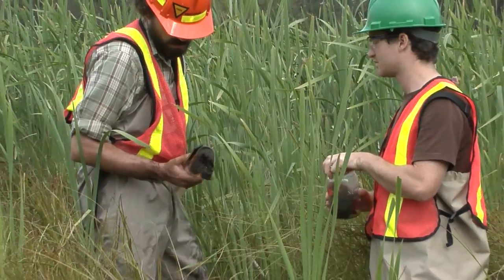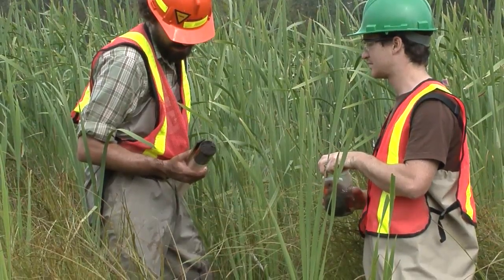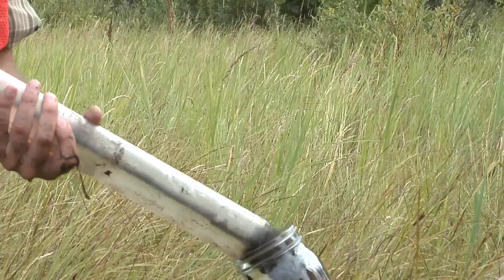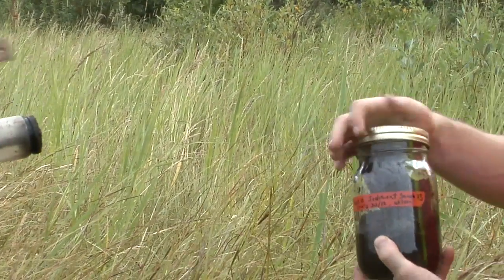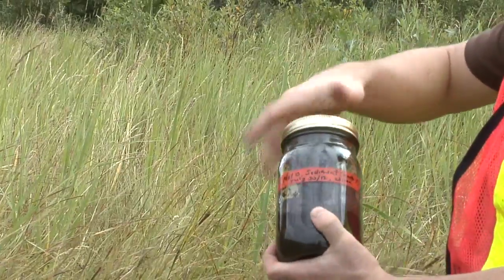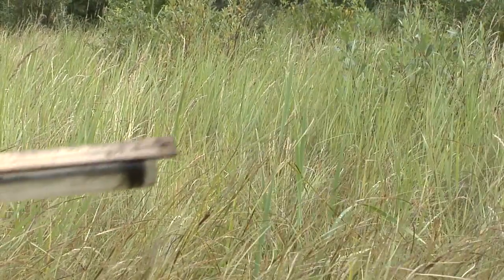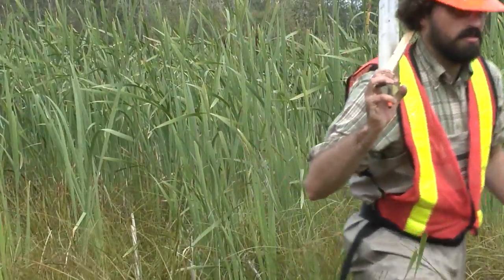Repeat this process at 2 other locations around the wetland. All 3 cores should be stored in the same glass container, as they will later be homogenized into a single composite sample. Sediment and water samples are transported back to the lab on ice for pre-processing, following protocols described in the accompanying handbook. Chemical analysis should be done by a professionally certified lab.